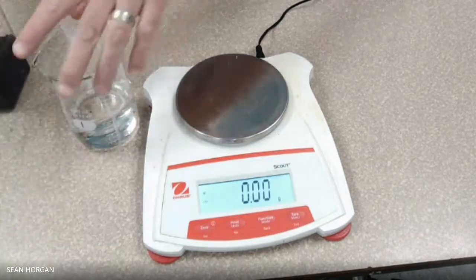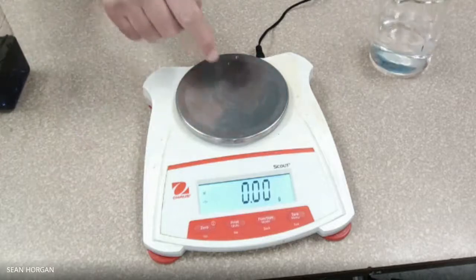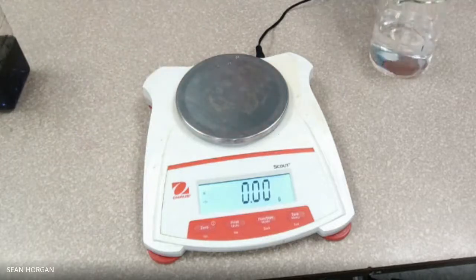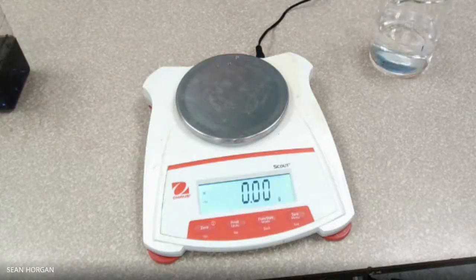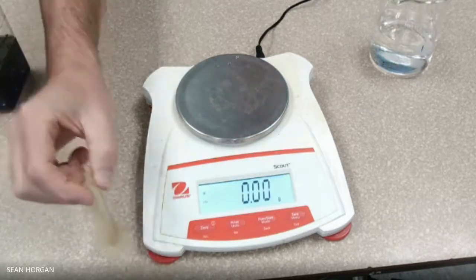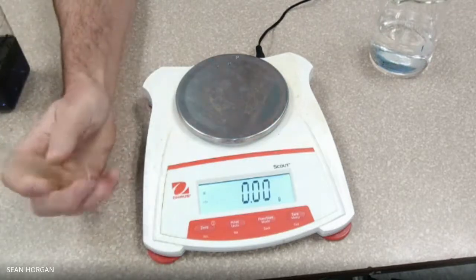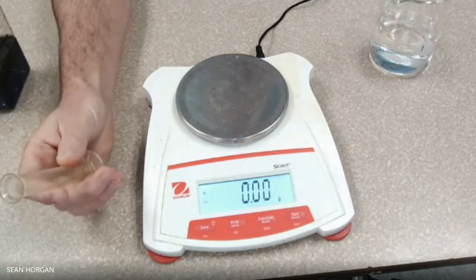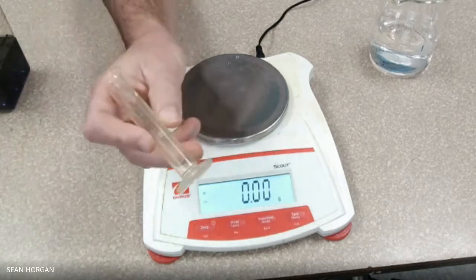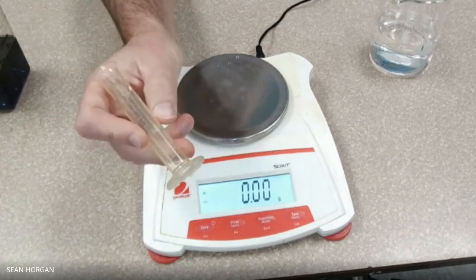So what we're going to do is use a couple different instruments. Number one, we're going to use a balance. Number two, we're going to use something called a graduated cylinder. A graduated cylinder is used to measure volume. If you look at it, we can see there are little marks on the side.